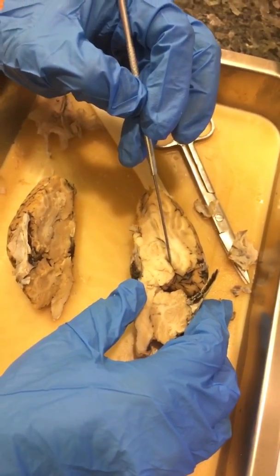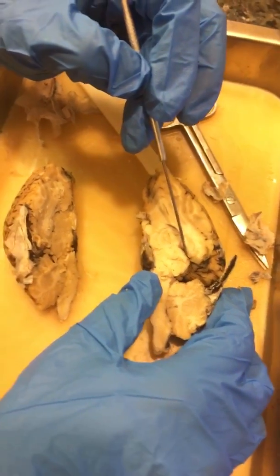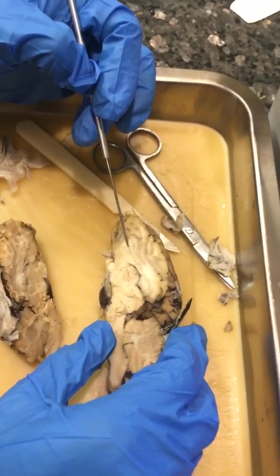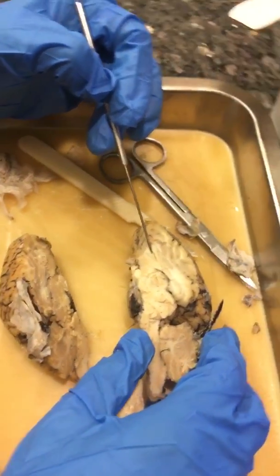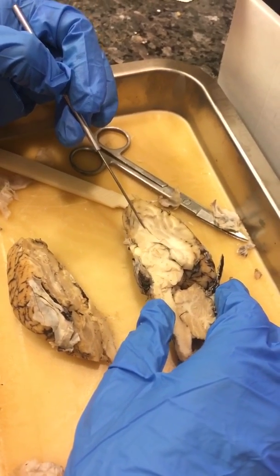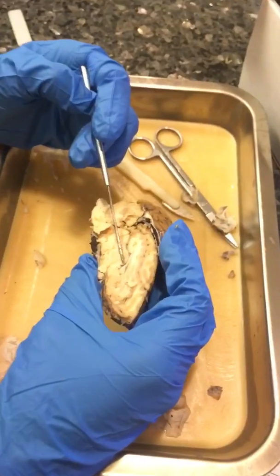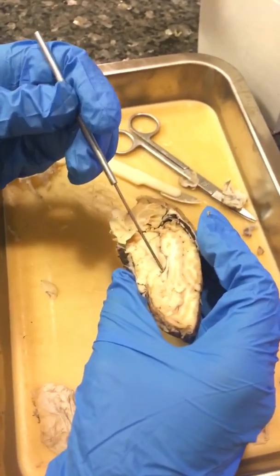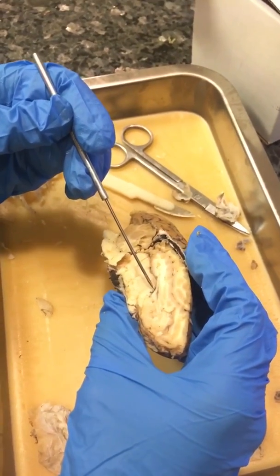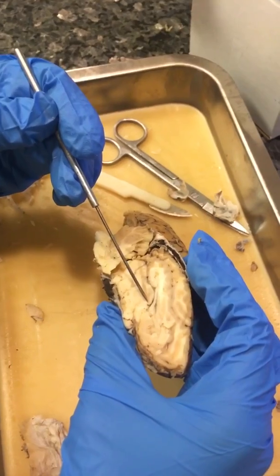Here we have the hypothalamus. The lateral ventricle is a little hard to see, but if you get close, you can see it right here. And here in the midsagittal section, you can see the septum pellucidum right here in this section. We're still on the midsagittal section, and here you can try to see the choroid plexus.